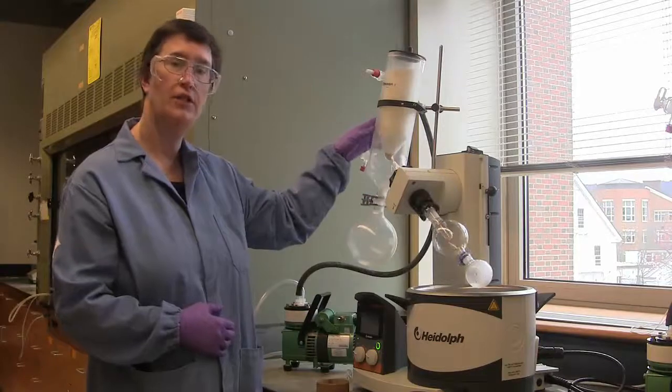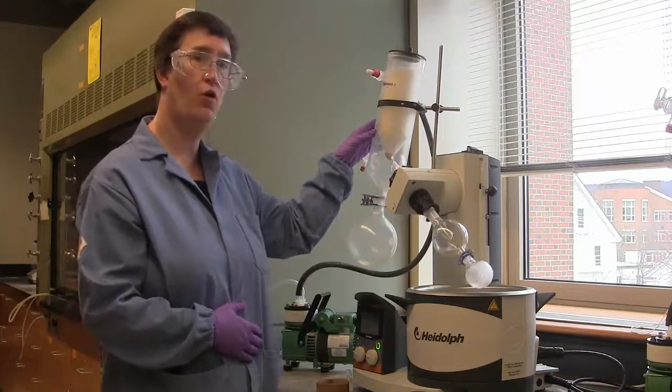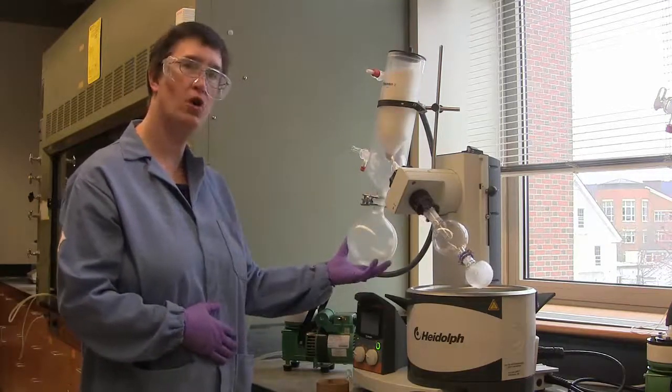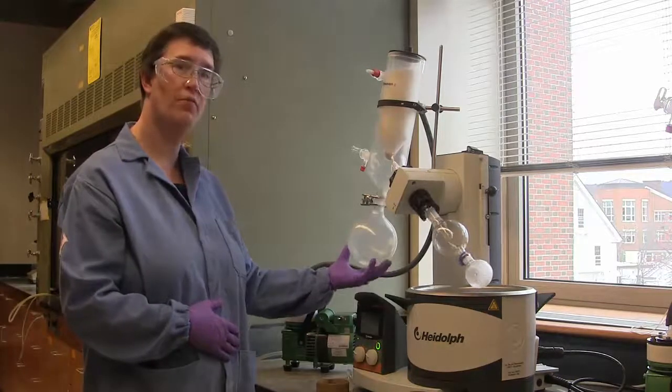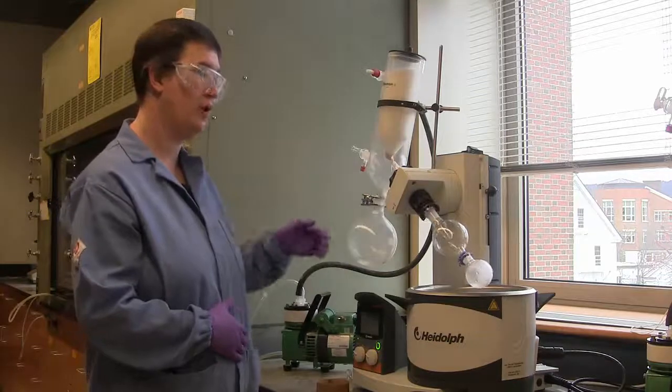When evaporation is complete, certainly you will have a slowing of the drip from the cold finger, but it may not stop entirely because the trap is also under vacuum, and you can get evaporation from the trap back up to the cold finger and get a reflux process there.